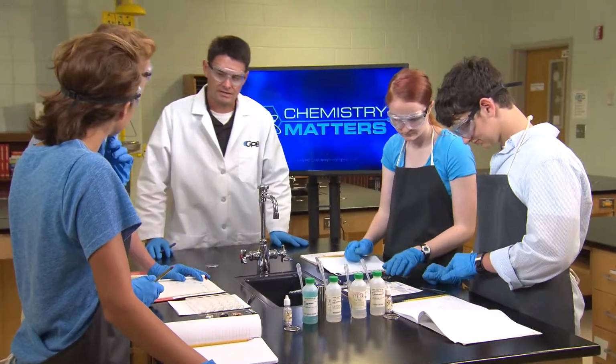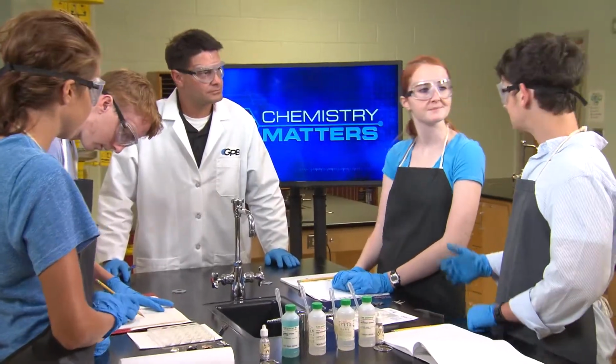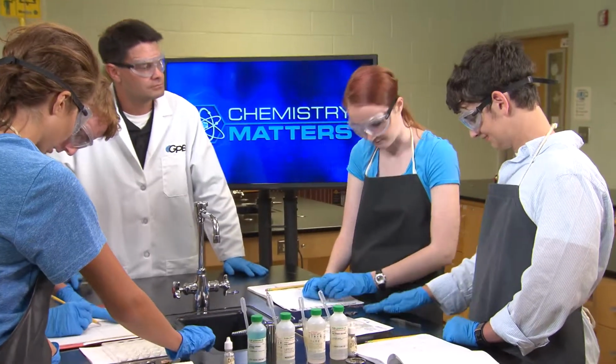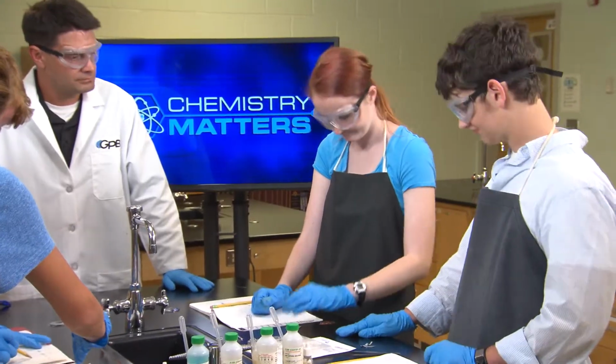Well, that's a good question. And as you can probably imagine, silver is very expensive. But for this lab, the silver nitrate solution will work just fine. All right, now we can start mixing things together. Let's split up. I'll take magnesium. All right, I'll take copper. I'll take lead and you have zinc.